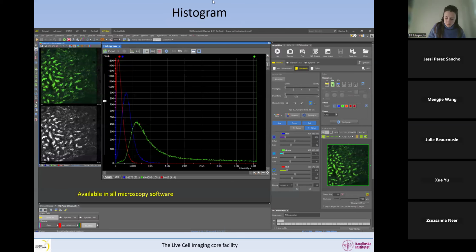So now we're going to look at the histogram. And the histogram is also a very good tool for you to check if you have correct settings. This is the histogram in this Nikon software, but it's available in all microscope software. What the histogram shows us is, for each intensity in the image, so this is a 12-bit image, the maximum is 4095. So it goes from 0 to 4095, and it shows for each intensity how many pixels. So it's the number of pixels that have that intensity in the image.